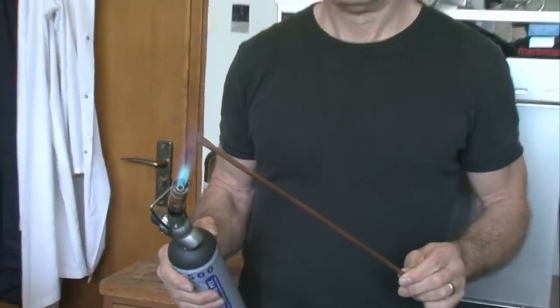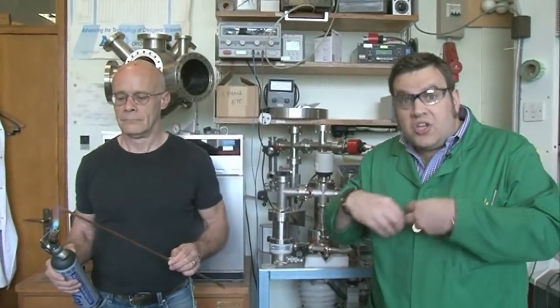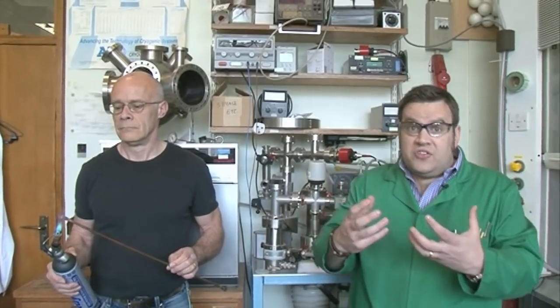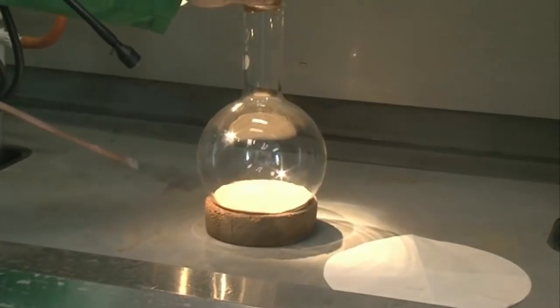So Neil is now warming up this copper rod which I'm going to use just to heat the phosphorus so that it starts to react, giving us that really quite nice combustion or that exothermic reaction with oxygen. Now we'll add a small amount of energy to the phosphorus and then we'll watch what happens.